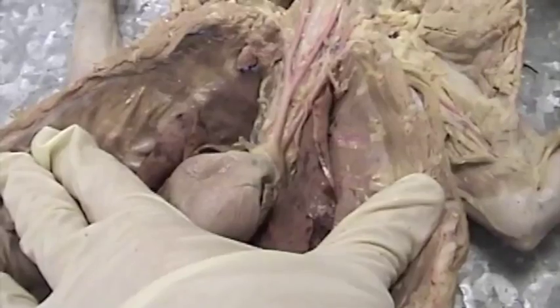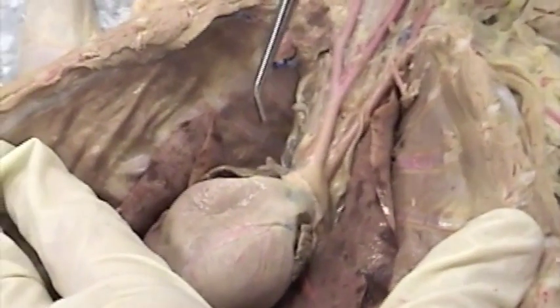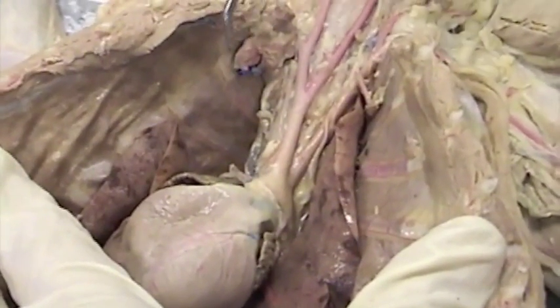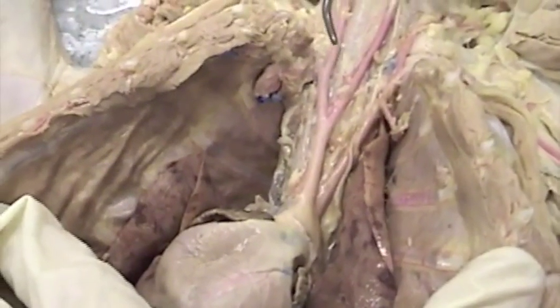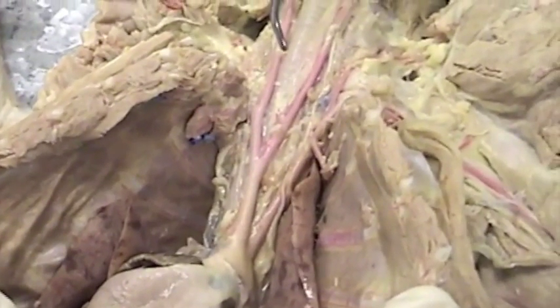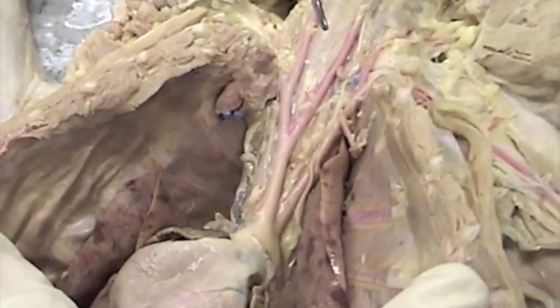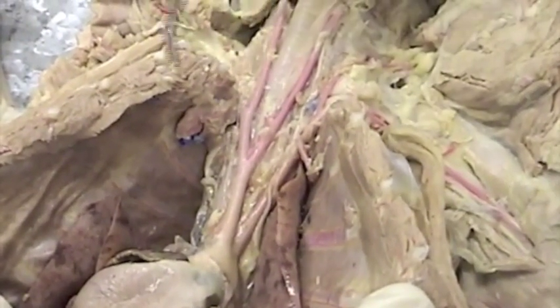All right, thoracic cavities. Now we're looking at the arteries, the thoracic arteries. In this particular cat, I have removed the thoracic veins just so that you're able to see the thoracic arteries a little more clearly. You will not do that in your cat. You will leave the thoracic veins intact and work around them.